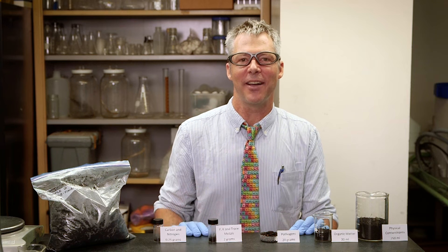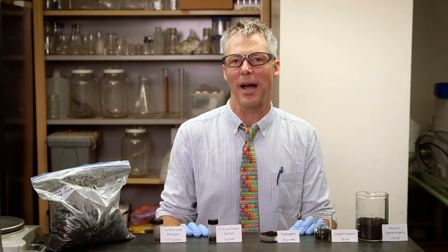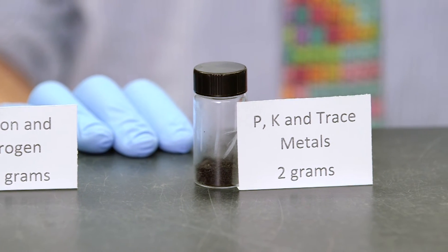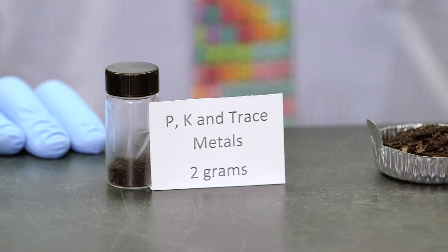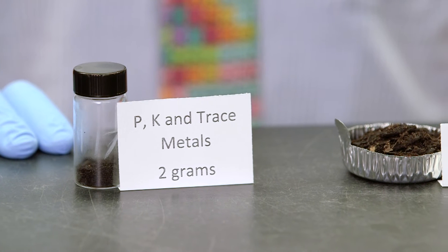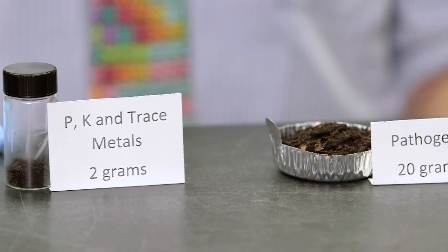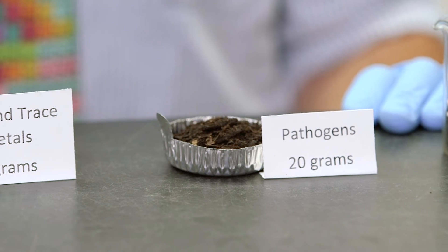The amounts of compost that labs use for several common compost analysis parameters are quite small. As you can see, blending the sample thoroughly prior to shipping to the lab is important in reducing variability of the analysis. Always call the lab prior to sampling to determine how much sample is needed for the analysis.